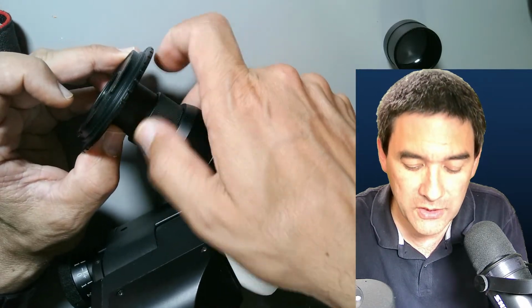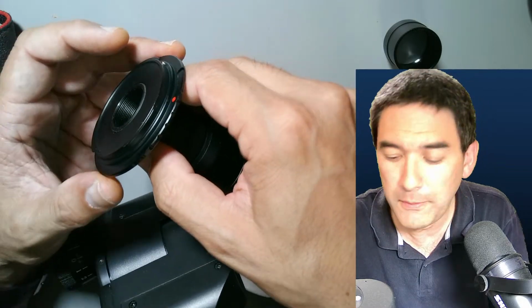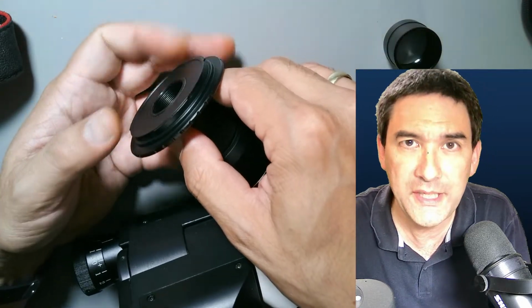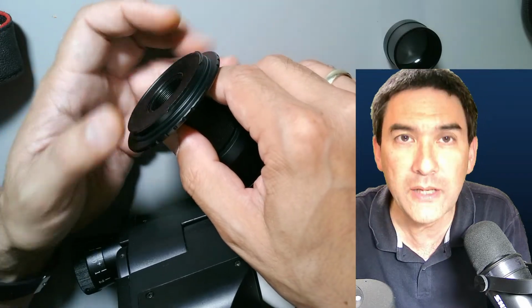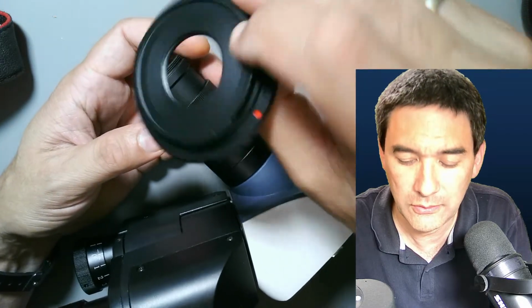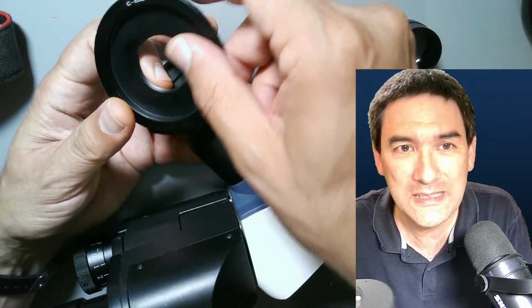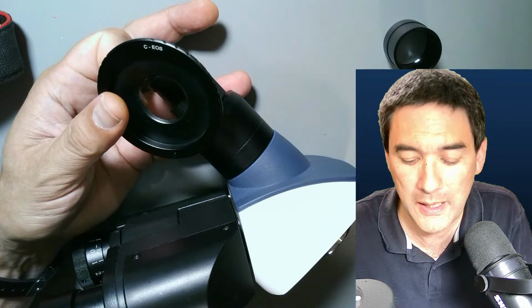So this is essentially something that I recommend: before you start investing something into here, maybe you just want to try out one of those cheaper C-mount to DSLR adapter rings. Yeah. And I've seen on Amazon, I mean, how much did I pay for this? Around 10 euros or so. Considering the fact that it's only a piece of metal, it's still, yeah. But if you already have a DSLR camera, it's at least significantly cheaper than those here, and you might be satisfied with this.